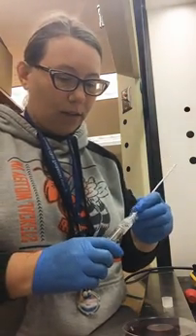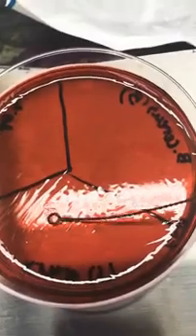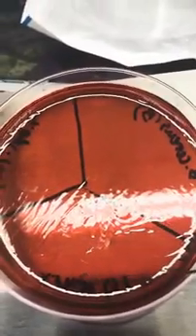Okay, this is my K. rhizo. Make this one a gamma. So again, I'm going to do it in the shape of the gamma symbol. So I got 2 out of 3. Next I'll just transfer my B. cereus to get my beta hemolysis. And then I'll put this in the incubator, and that's all there is to it. So you're just going to set up tomorrow, read results on Thursday, and then Thursday you'll probably get started with your unknown, your last unknown. So see you tomorrow.